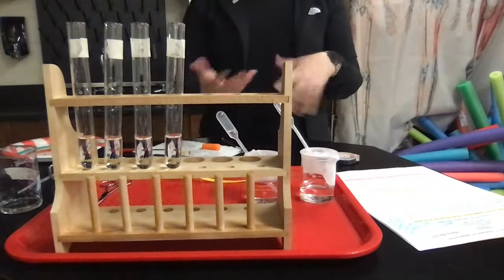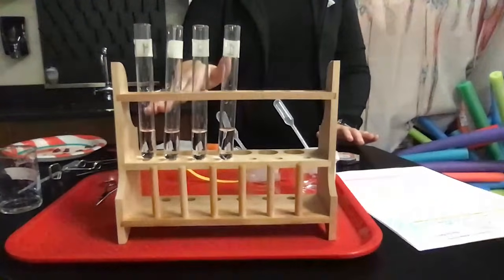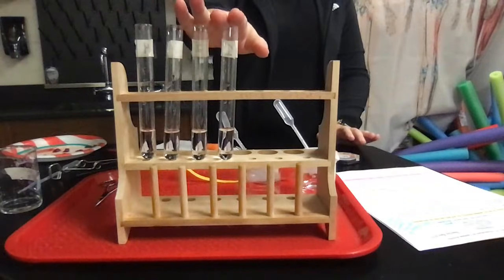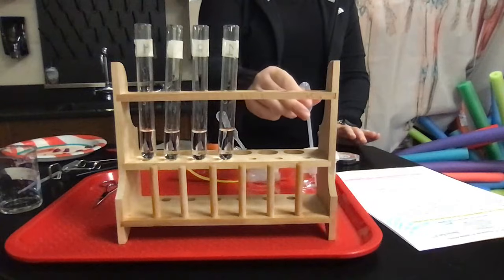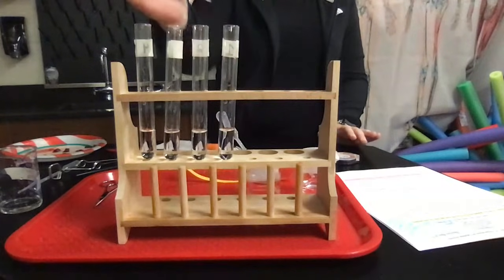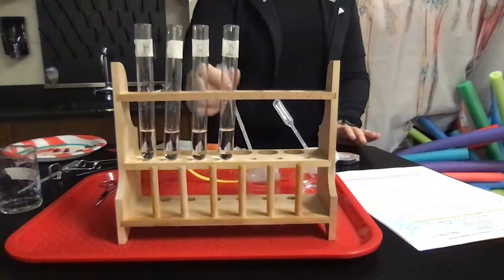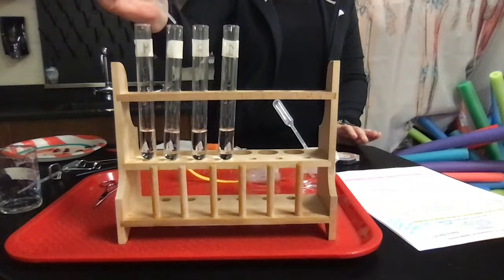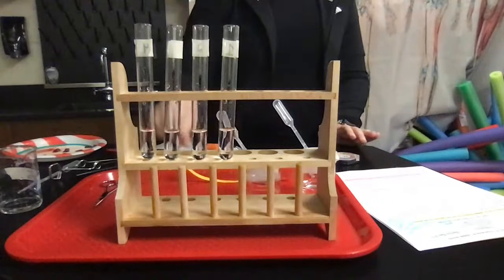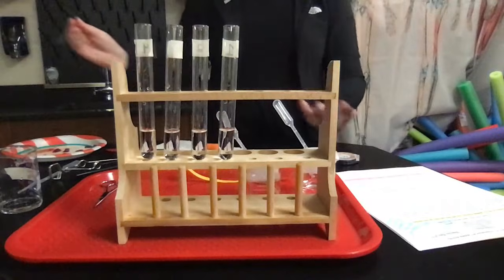So again, I have 4 test tubes here that have hydrogen peroxide in them. I'm going to leave test tube 1 alone. And to test tube 2, I'm going to add a few drops of concentrated hydrochloric acid. Literally a drop is going to make this very acidic. And then to test tube 3, I'm going to add 1 drop of concentrated sodium hydroxide, which is going to be a base for us. And to test tube 4, I'm just going to wing it based on the pHs of the other 2 that we've changed here.